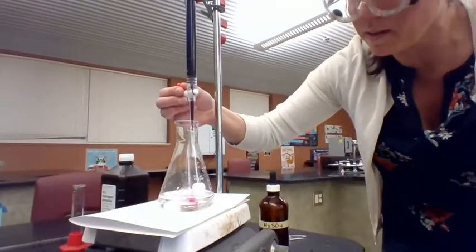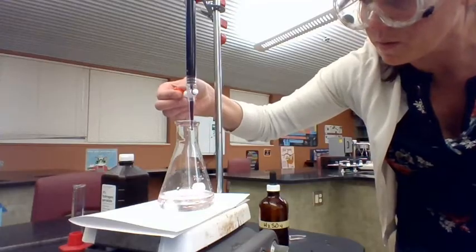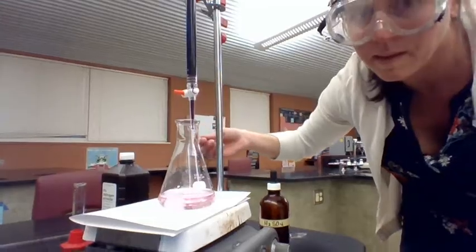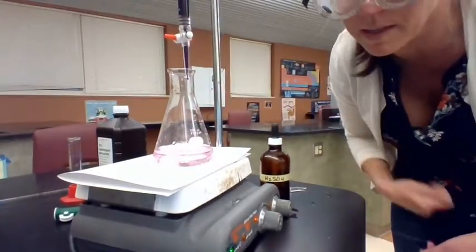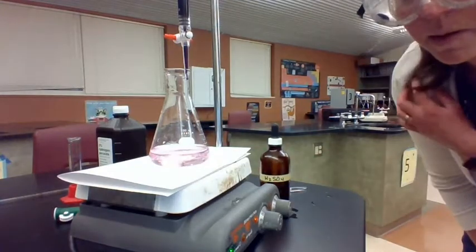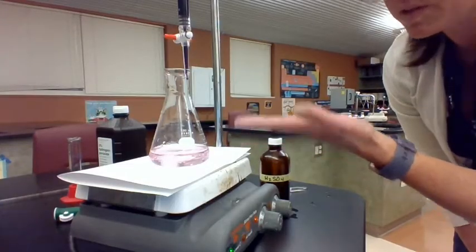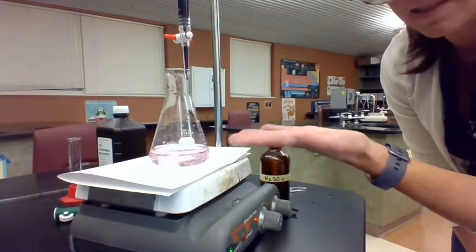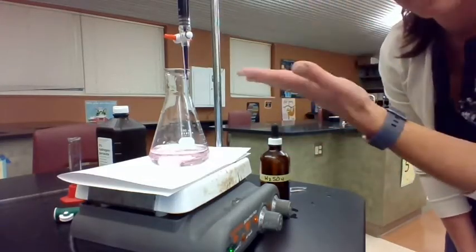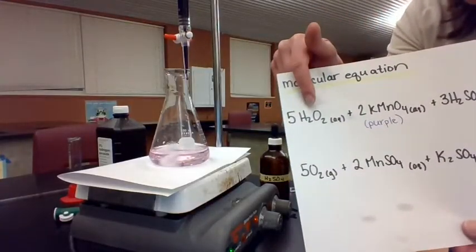Let's see if we can get a better view. I'm almost there — maybe like one more drop. You see how right now my solution is staying just this faintest pink color. That means I have reached the end point of my reaction because the permanganate has nothing to react with anymore. When I add a drop of permanganate now, it just stays as permanganate. I'm at the point where I have excess permanganate, which means all of my hydrogen peroxide has been used up.